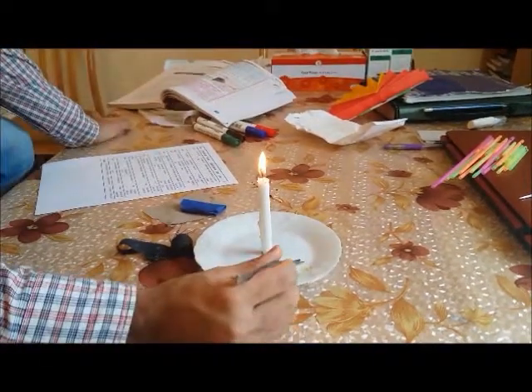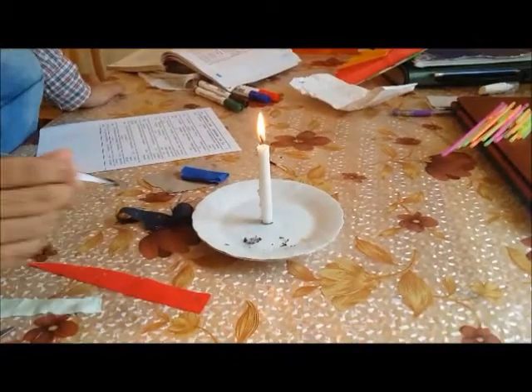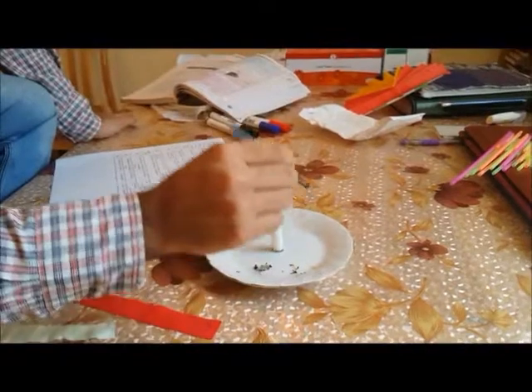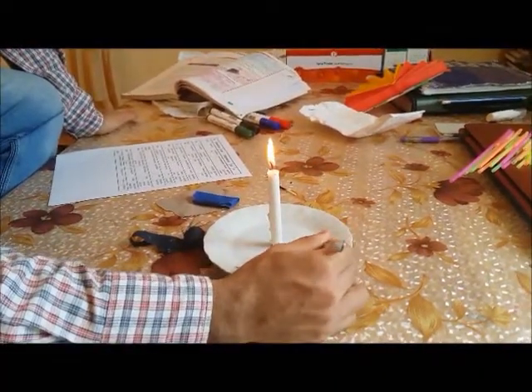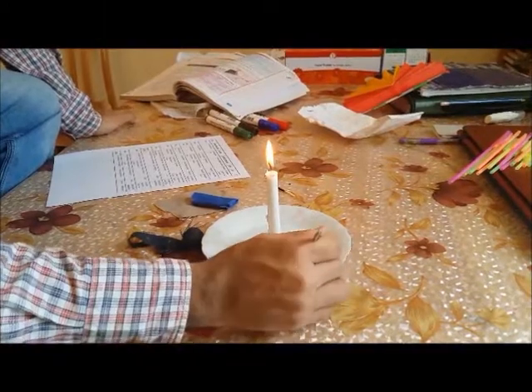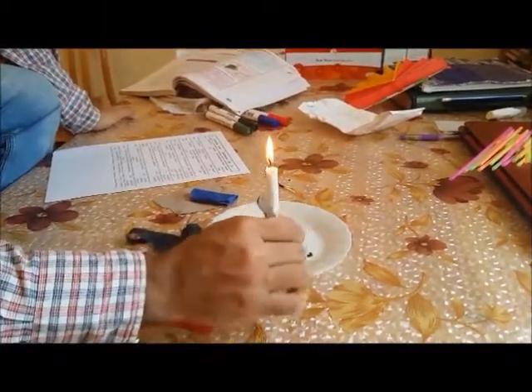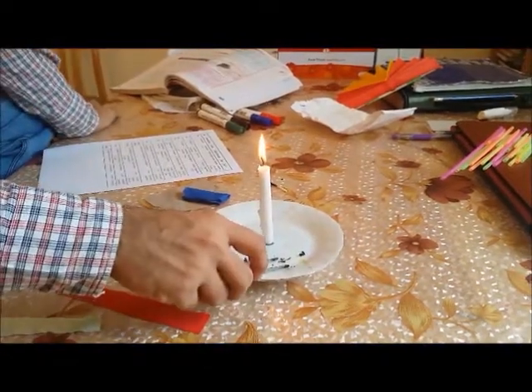And the final residue — when I try to see it, you see how it jumped over here. And look at the sound. It is like a very hard bead type — this type of hard bead that is difficult to crush.